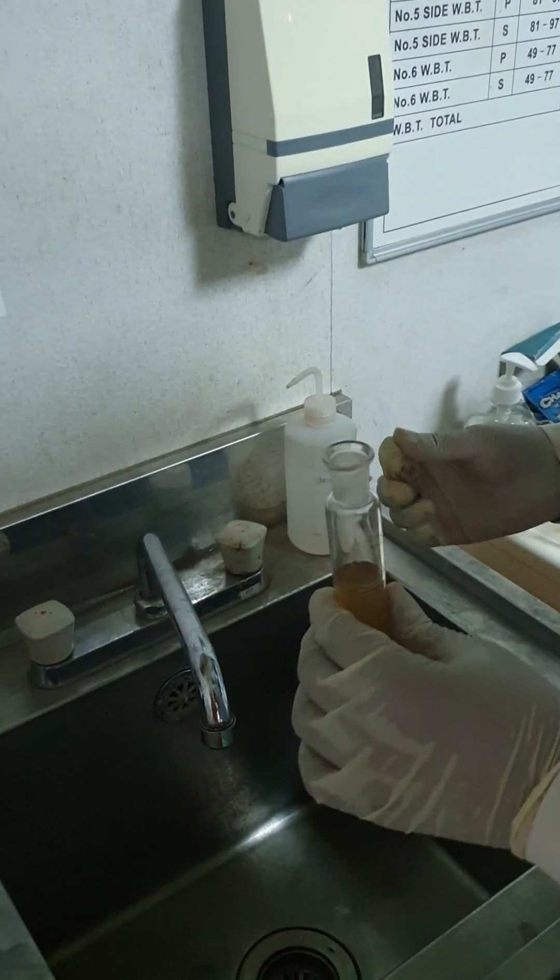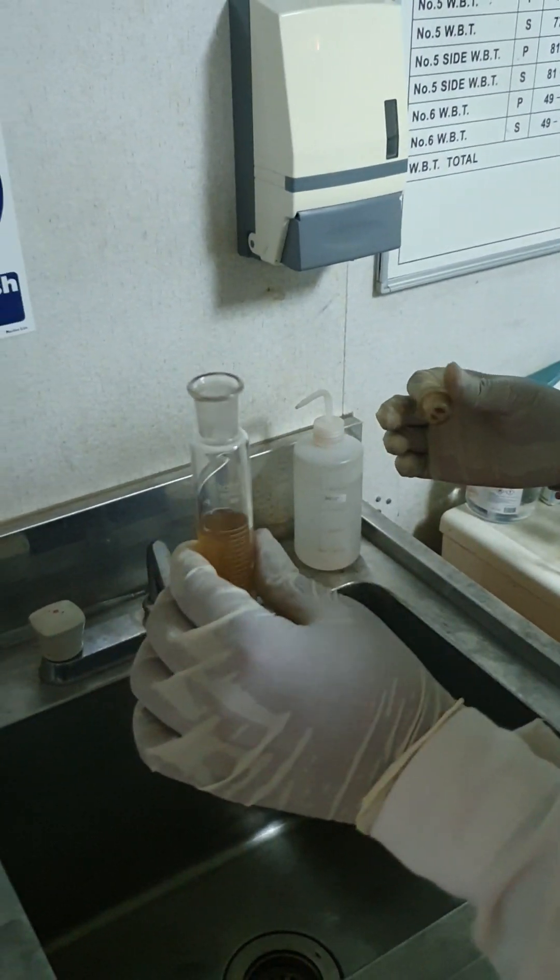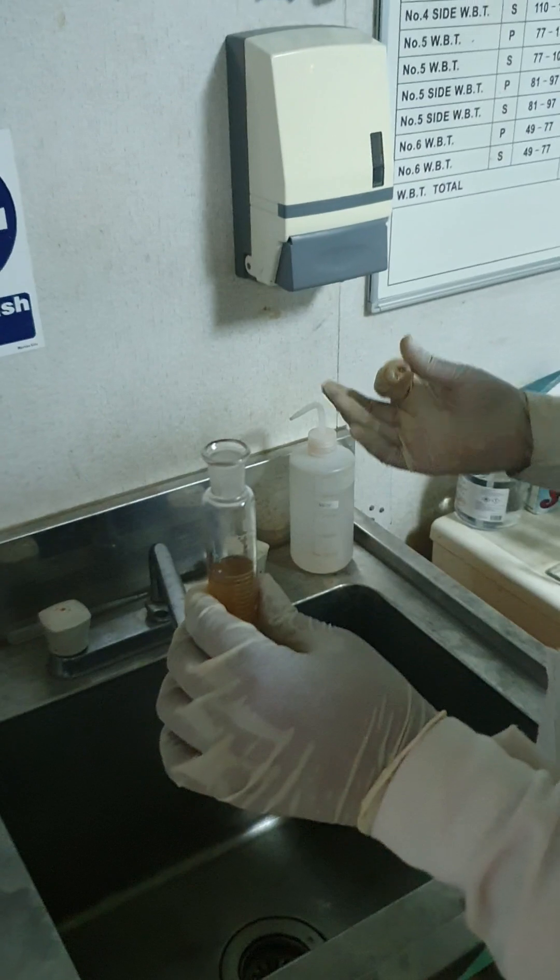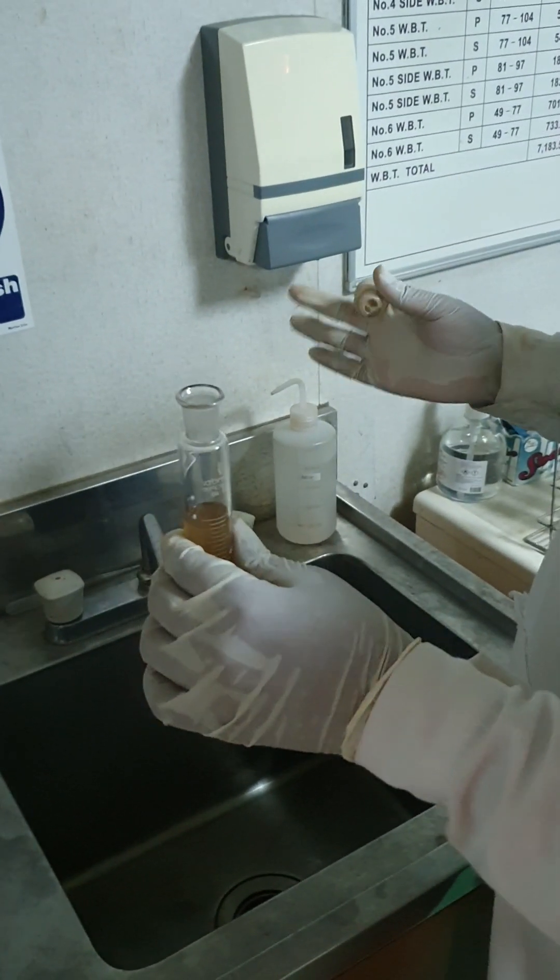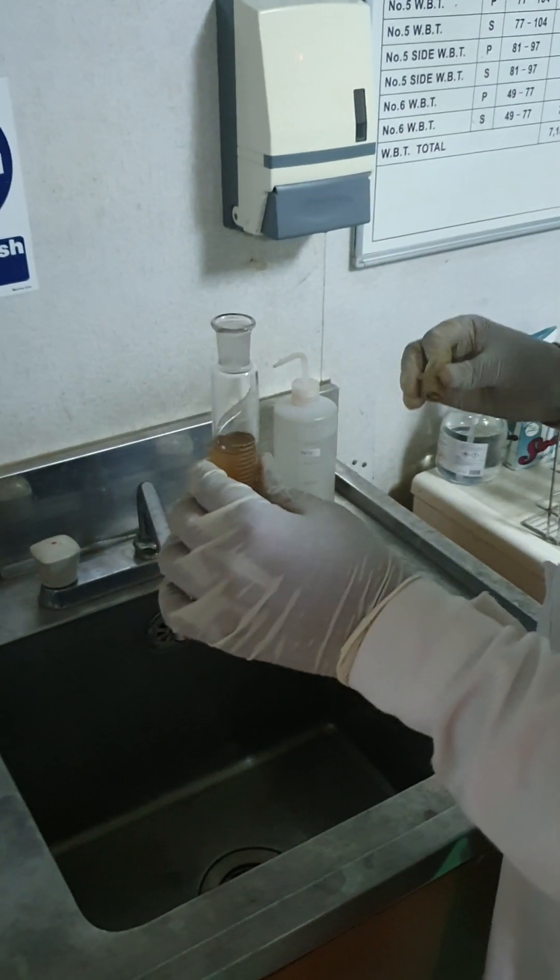Okay, and then you will put it in the refrigerator. Normally, for PTT time test, the shipper, they will give us their Valor standard. They want within how many degrees Celsius and within how many minutes to color change.